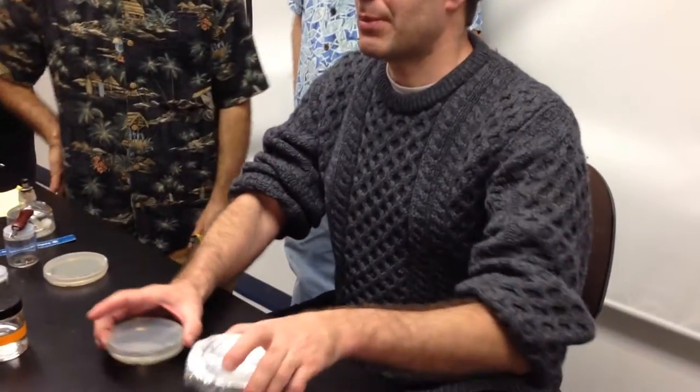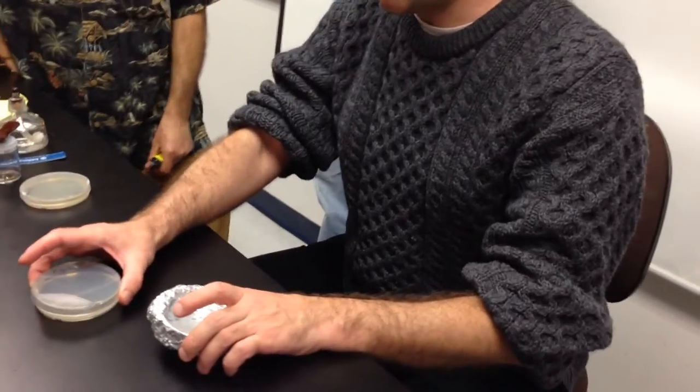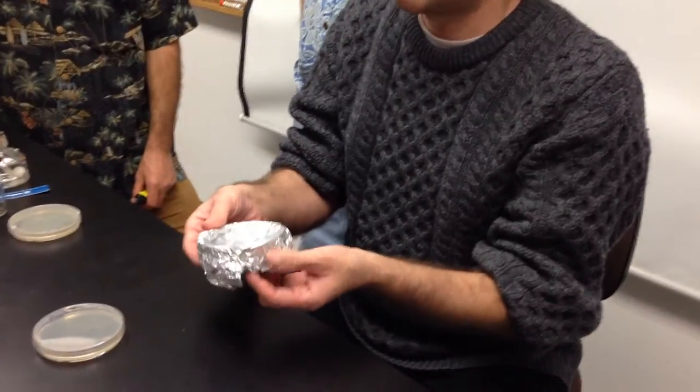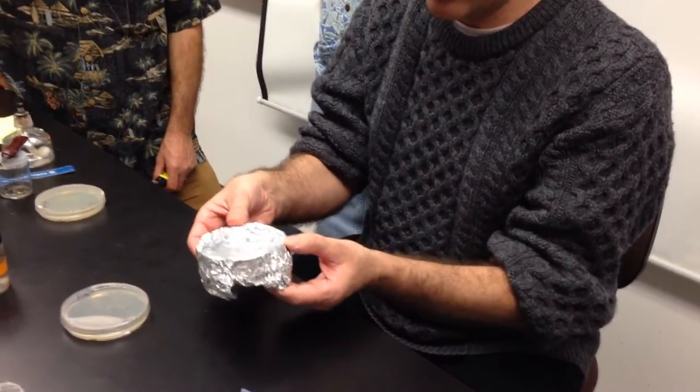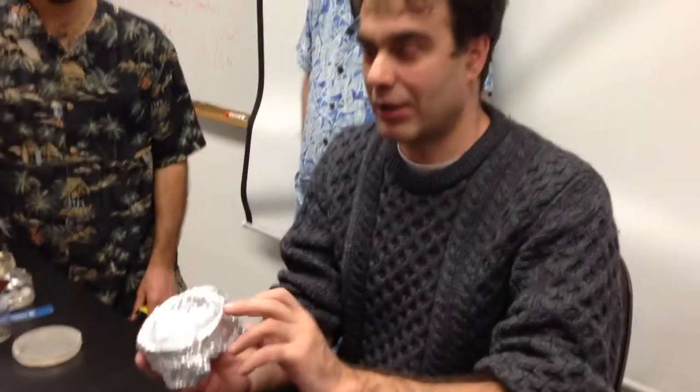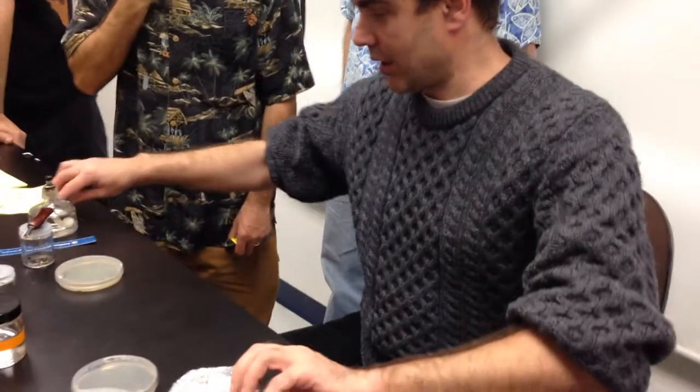A little frog is just waiting patiently. Let's get his photograph. I got this from some journal — a British journal for pedagogics, or whatever. I forgot, but I can send you. It's actually not online, so it was hard to get. But it works like crazy.